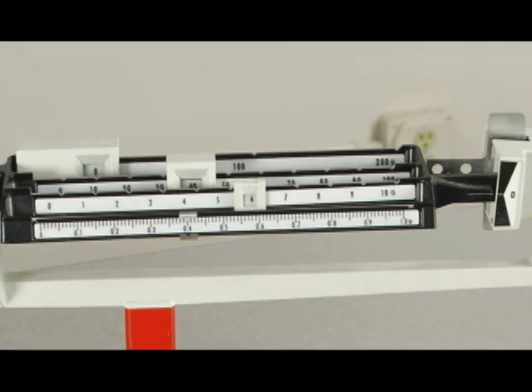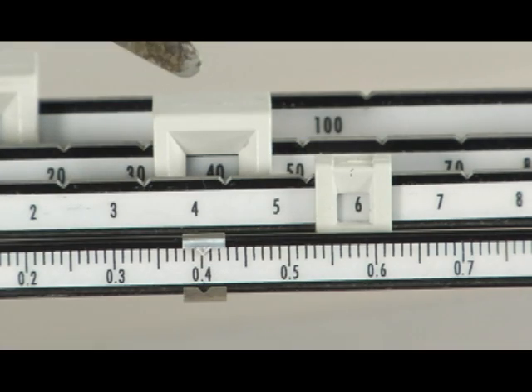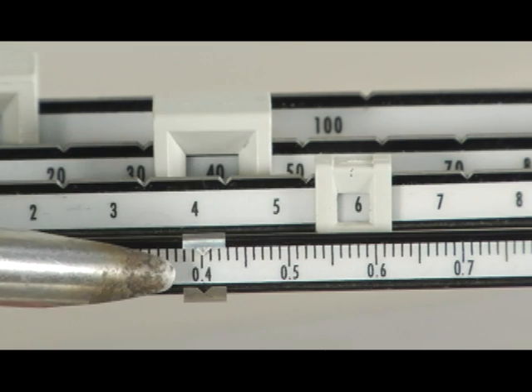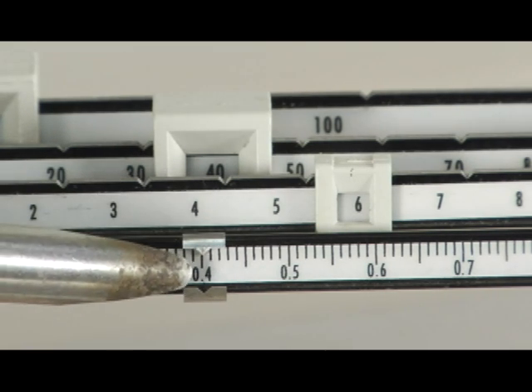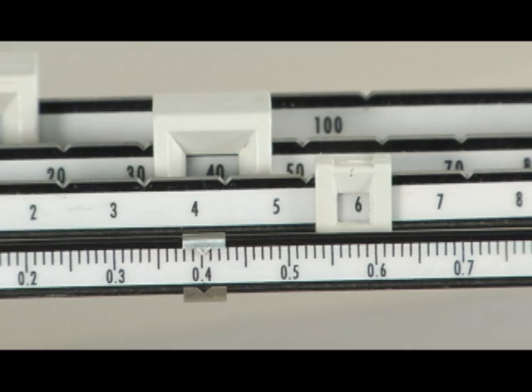So this number, we would say that it is 46.4, we've reached the .4. When we look carefully at this notch, we haven't reached .41 yet, so our value is .40. Then we look between those two lines how far it's moved over.